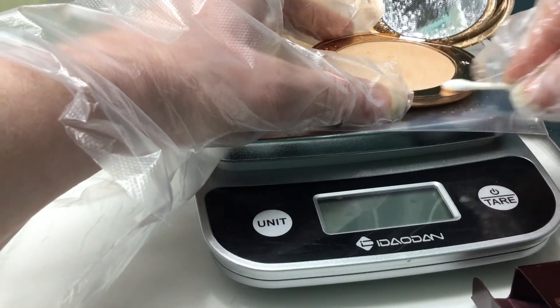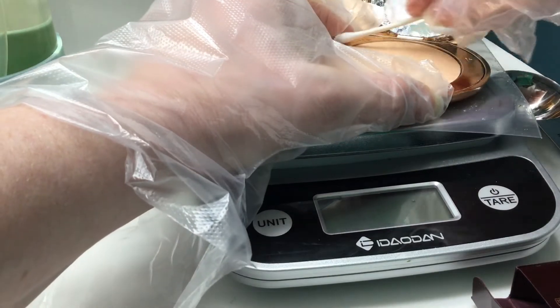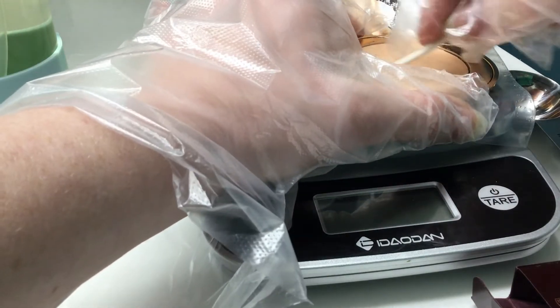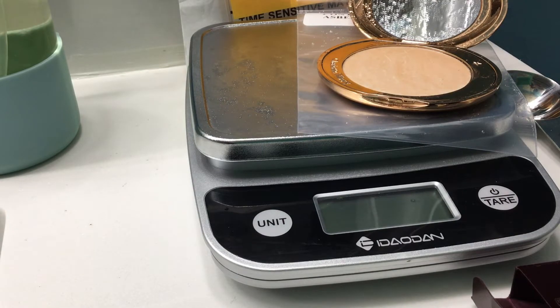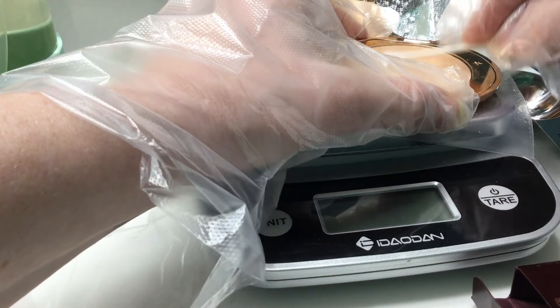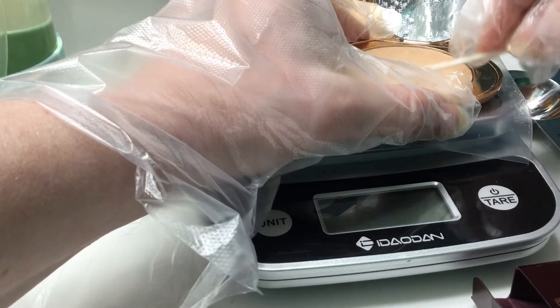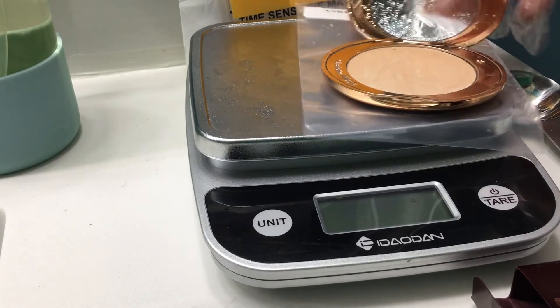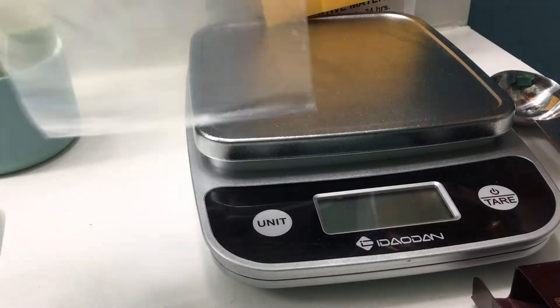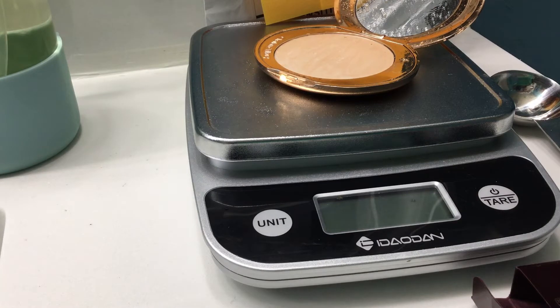It's turning into a paste. I don't want any cross-contamination here, so I'm going to take the whole top layer off. I'm aware I sprayed my scale, but the sample size... There's going to be a lot of crinkling involved, so can we just turn the volume down or watch this on mute?